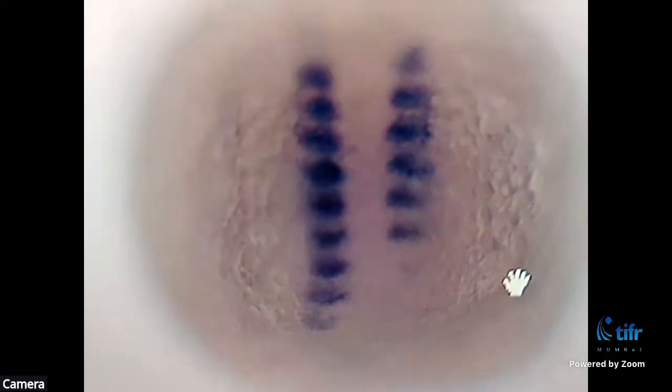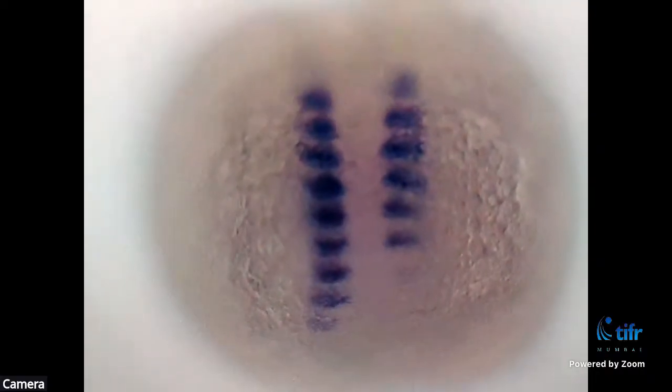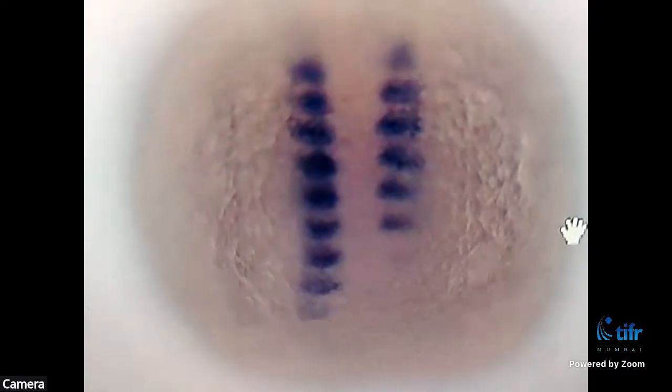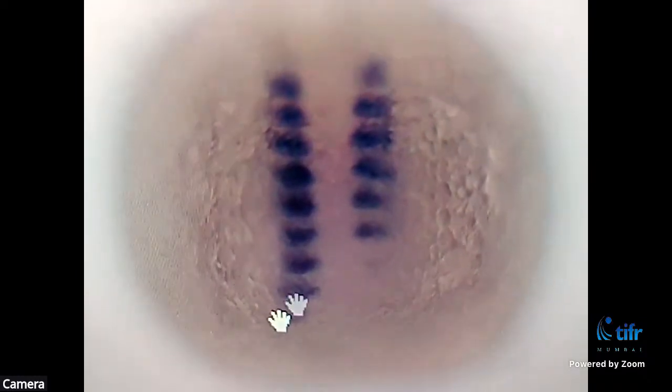Because when you explained that, it was not very visible on camera. So can you go back a minute earlier? Yeah. So this is the left side of the embryo. This is the right side of the embryo. You can see that on the left side, there are more somites that have developed and stained with respect to the right side. So this is the asymmetry which I was talking about. As I have already mentioned, these kinds of asymmetries lead to a condition called scoliosis, where people have a bent spine or a curved stature. And now Shweta will be explaining another staining technique which we use in the lab.